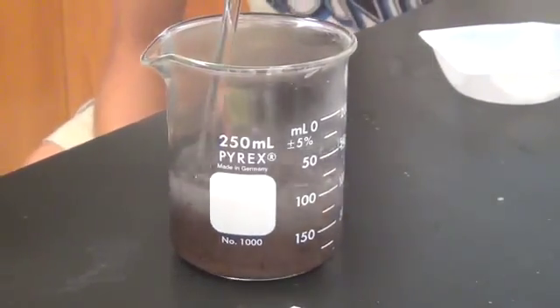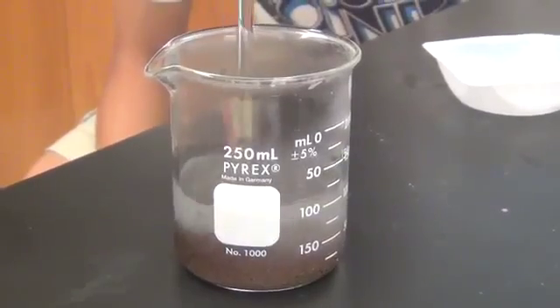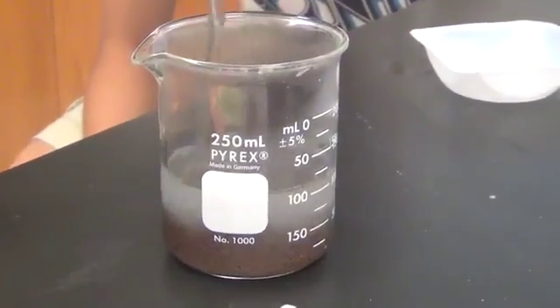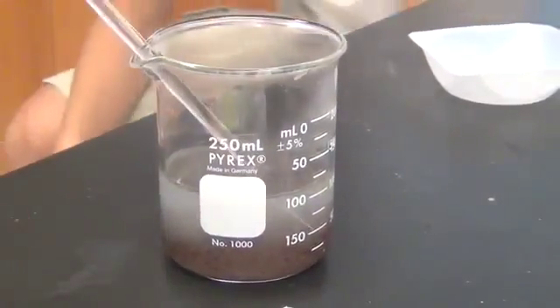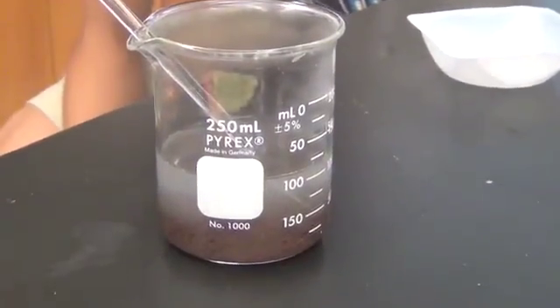1 minute 40 seconds. So do we have excess zinc or anything still? I think so. Let it settle so you can see all the stuff. I'll zoom in. Okay, filtering this should probably be a lot easier.